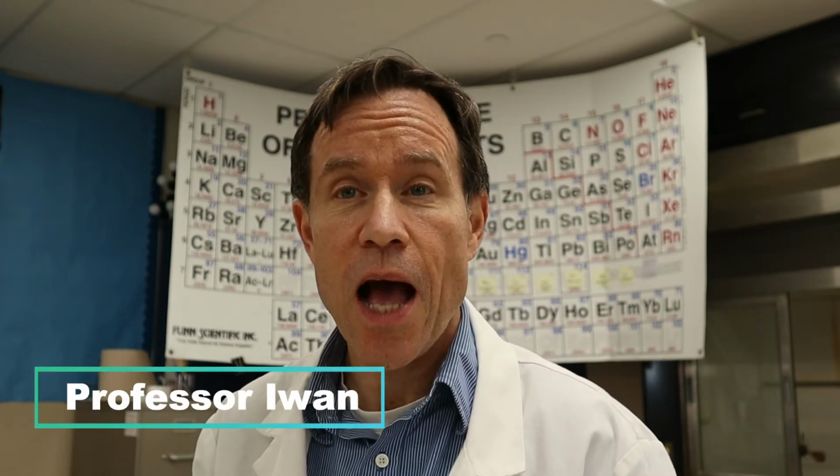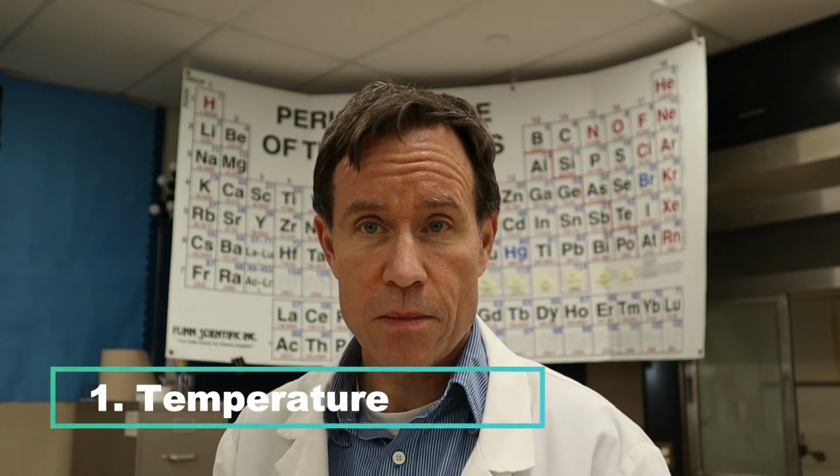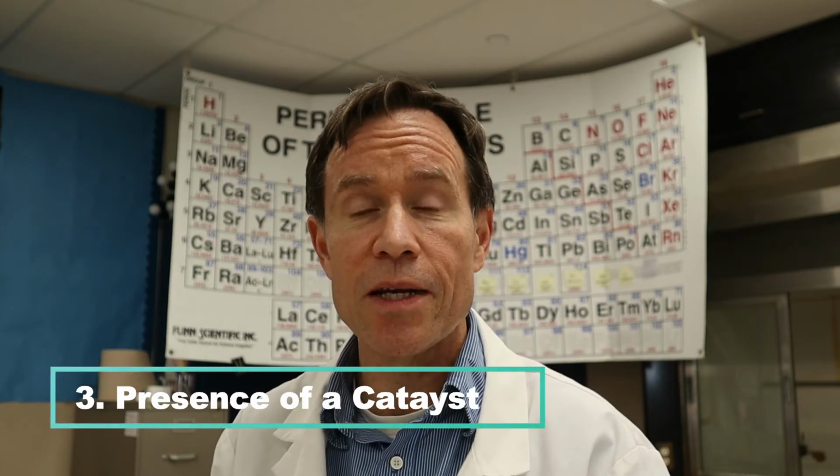Today we're going to be doing the iodine clock reaction. This is one of my favorite reactions. I love this reaction. Kinetics is the study of the rate of chemical reactions. There are three factors that can affect the rate of a reaction. The first one is temperature. The second one is concentration of the reactants. And the third one is presence of a catalyst.